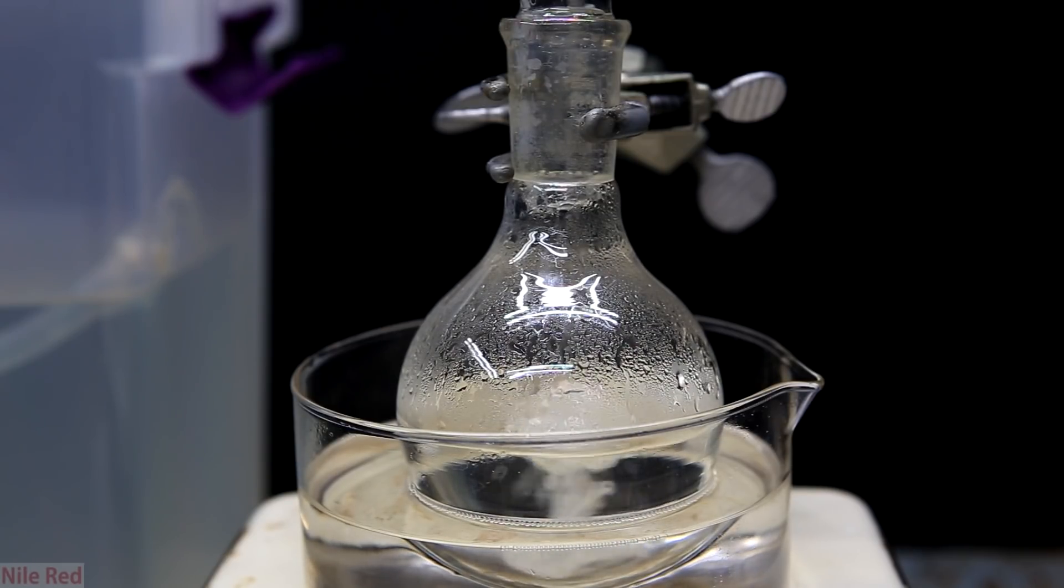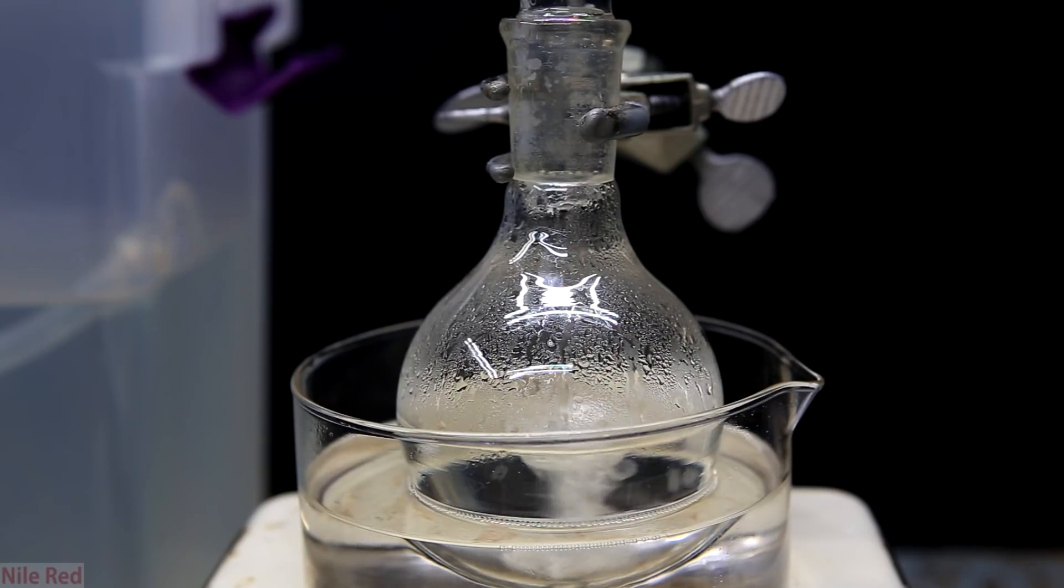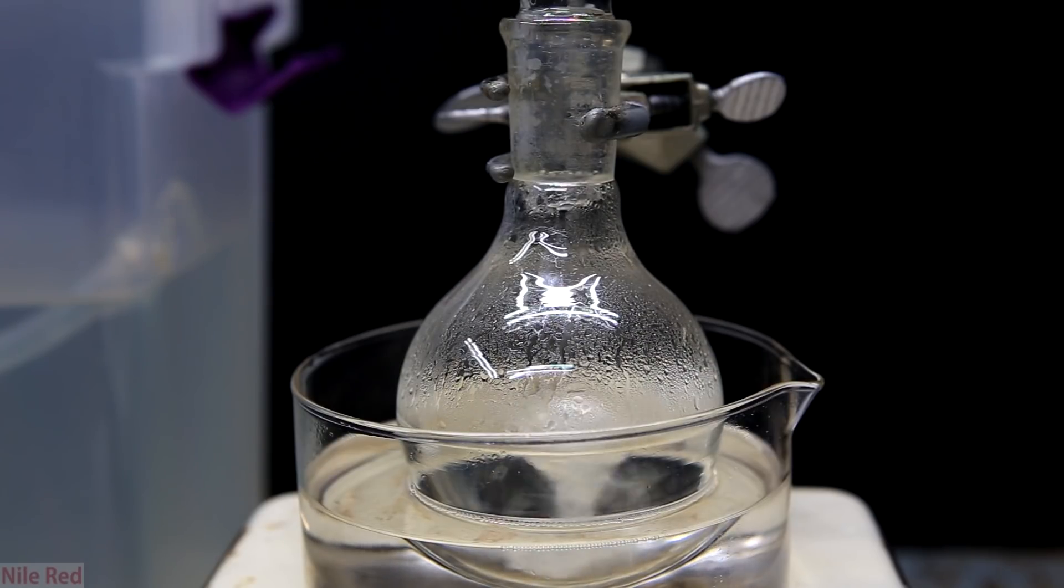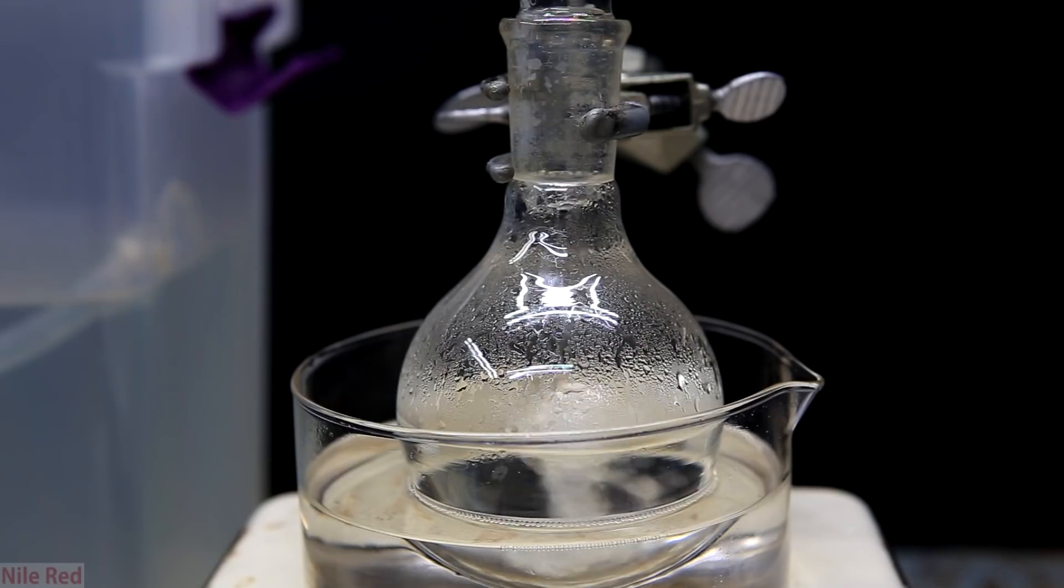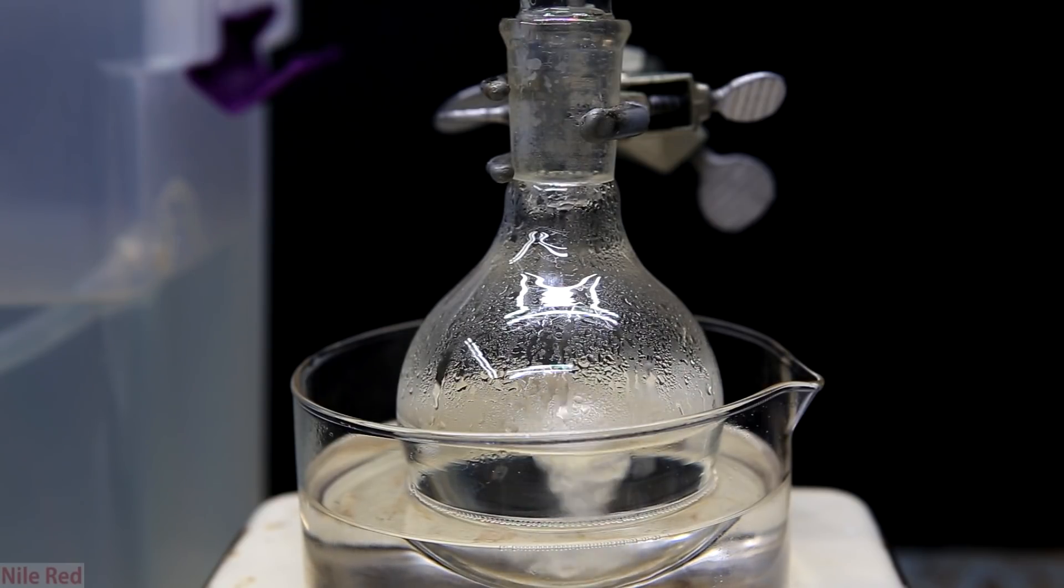Not only does heating things up generally increase reaction rates but we're also getting the vanillin to dissolve into solution. With the increased reaction rate due to the heat and with the vanillin actually dissolving into solution we run this reflux for 20 minutes and the reaction should be done. If the reaction wasn't heated we'd be probably left with a mess of vanillin mixed with vanillin oxime and it would probably take hours or days to even get close to completion.